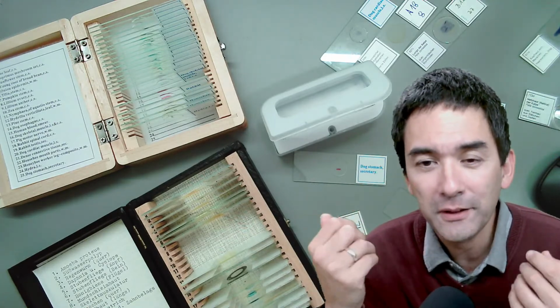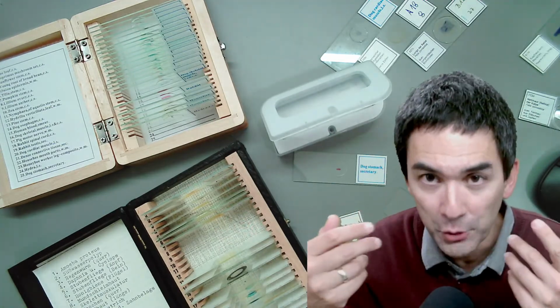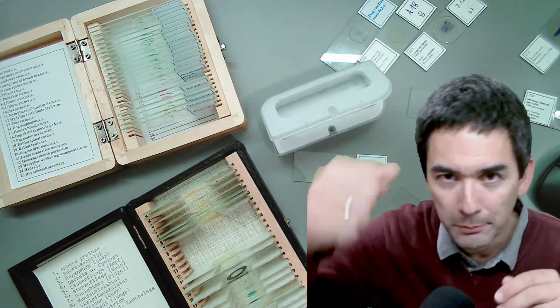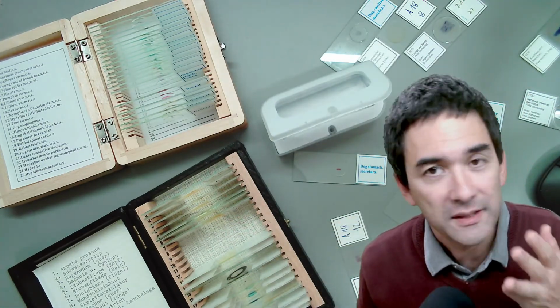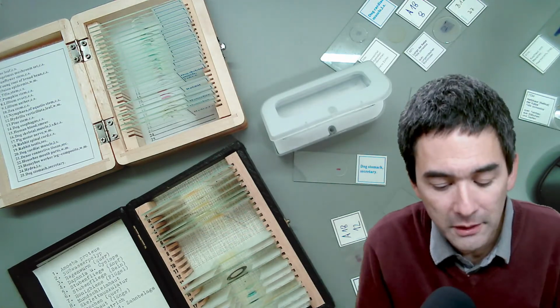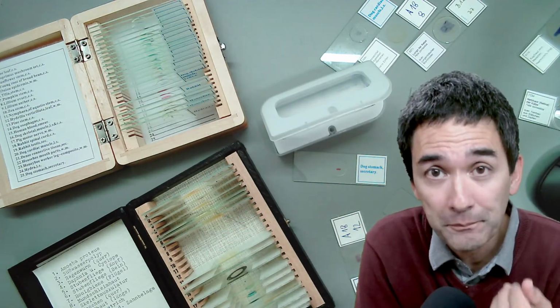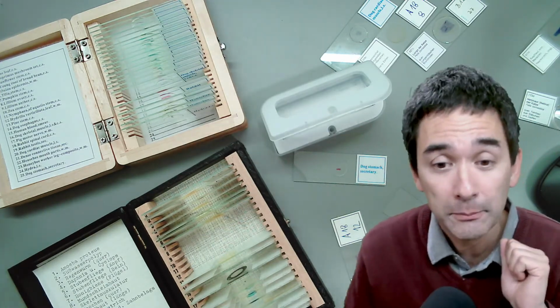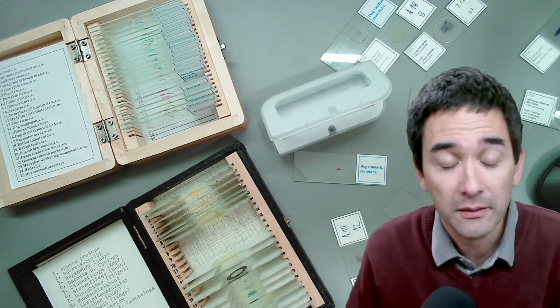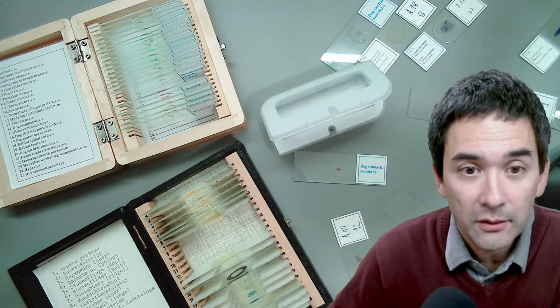What I've done is, because I've got monthly disposable contact lenses, I simply cut them up and put them under the microscope with some methylene blue. You can watch the video, but the same principle applies when you want to look at blood. You just take a small drop of blood, add some methylene blue solution, Löffler's solution, which is a ready-made diluted solution, mix it, and put the cover glass on top, and you can actually see the white blood cells quite well. It's pretty straightforward.